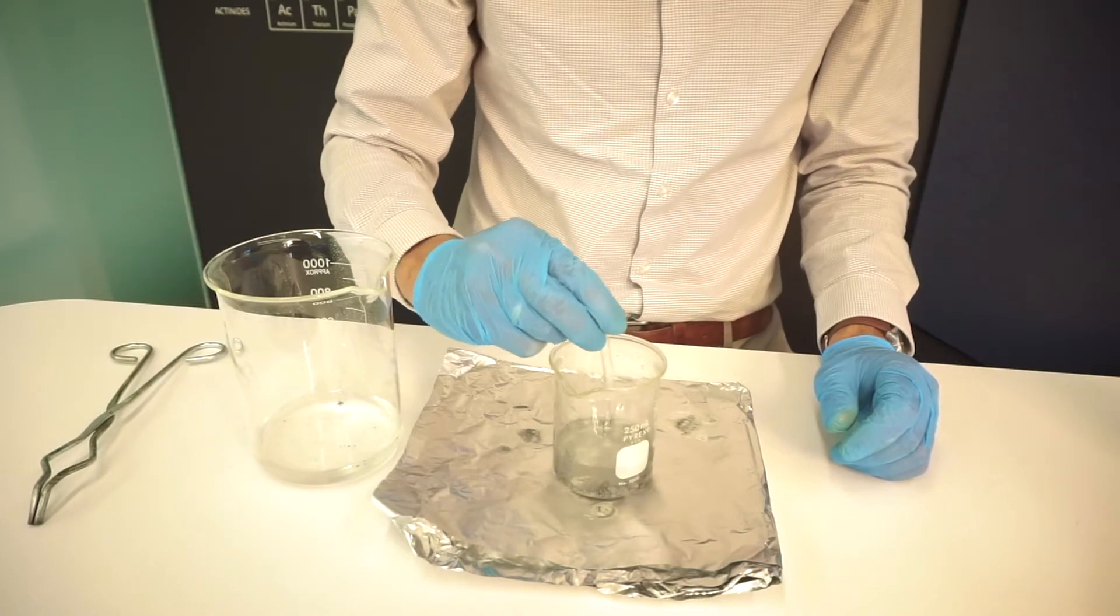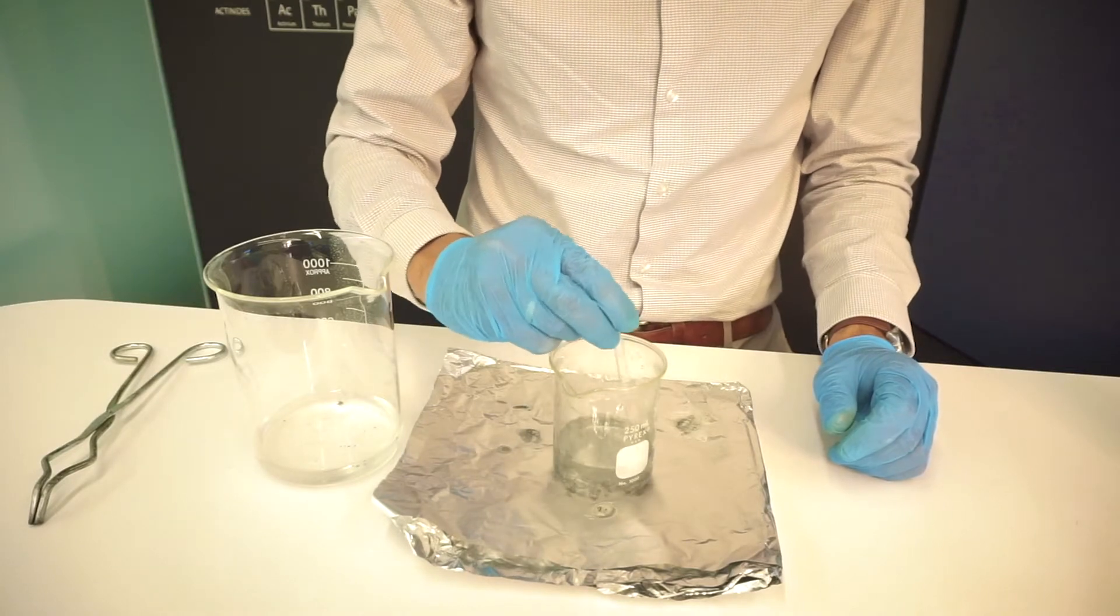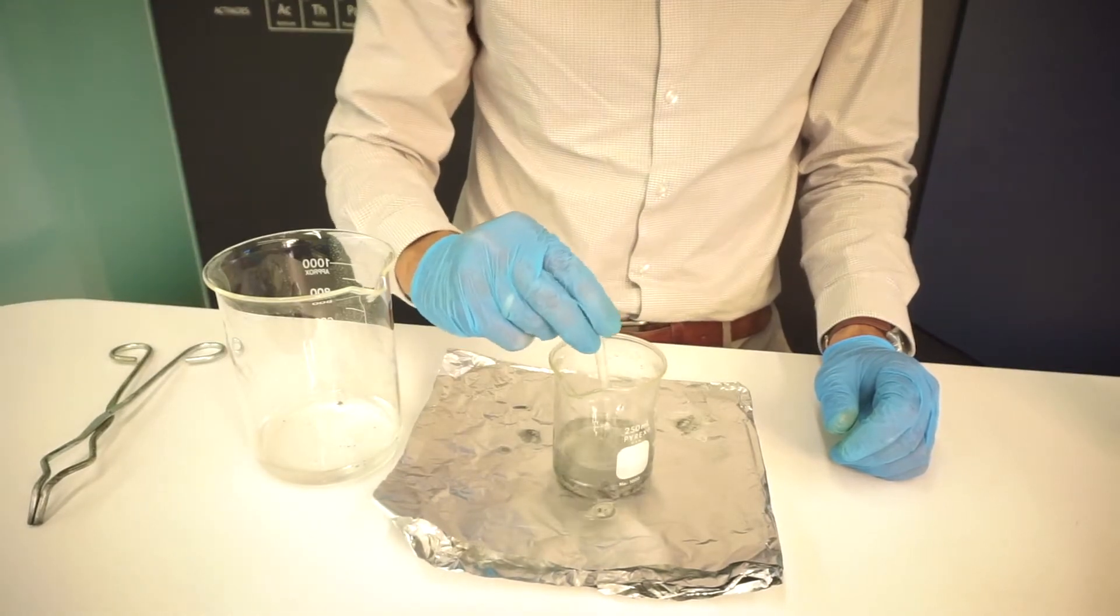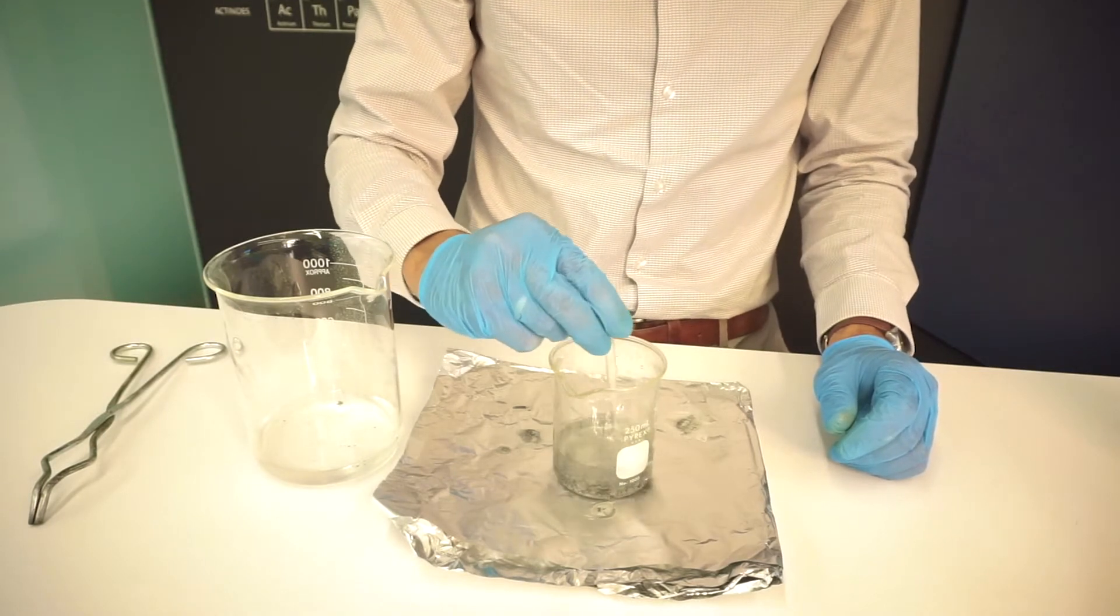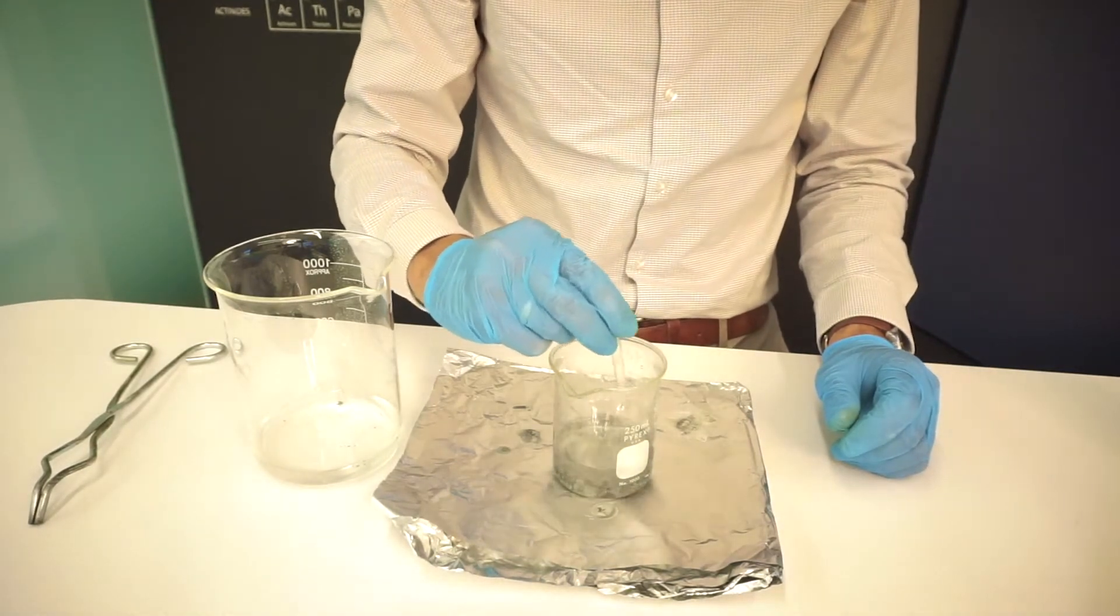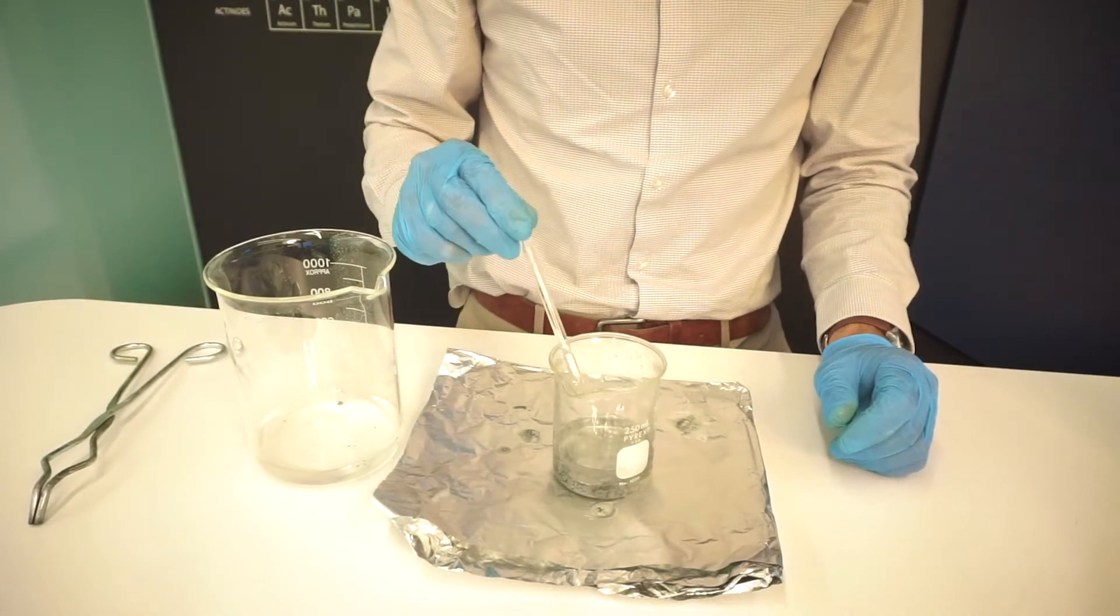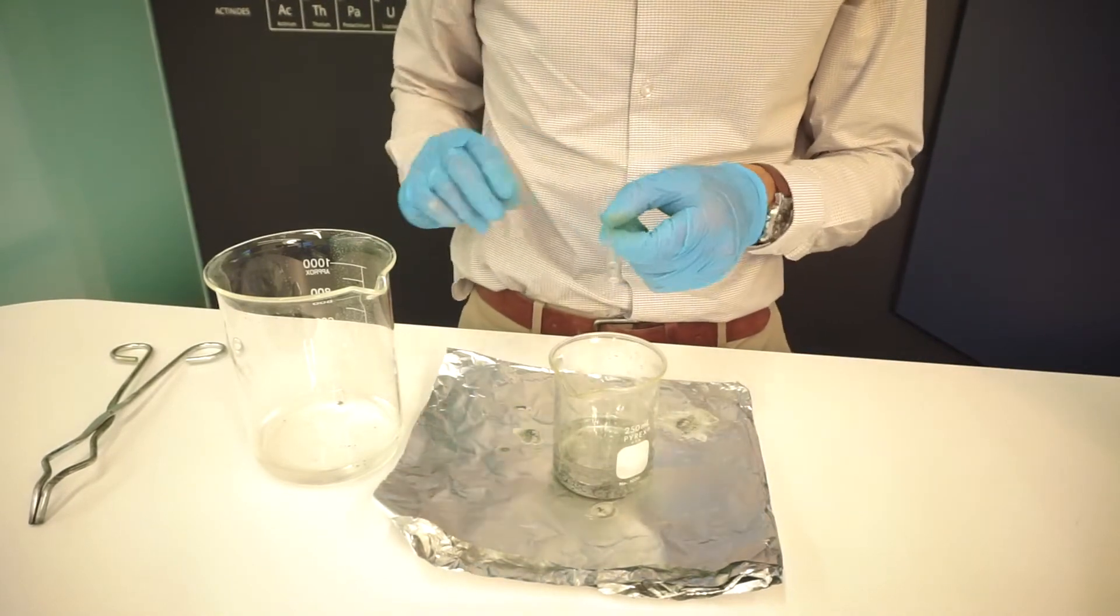What's going to happen is the copper is going to get displaced by the zinc that's in solution because this is a galvanic displacement reaction, and zinc is more reactive than copper. In other words, copper is more noble.